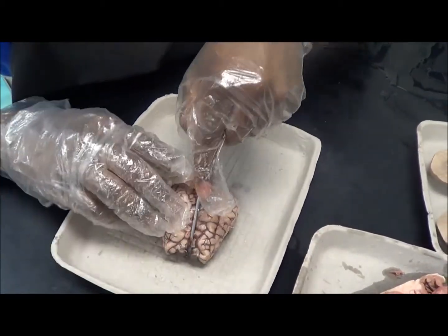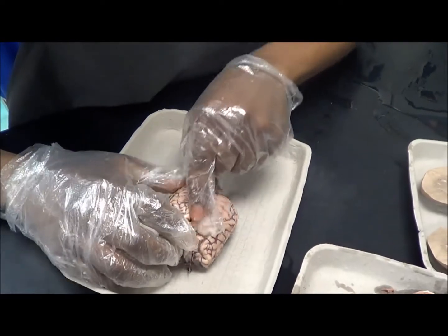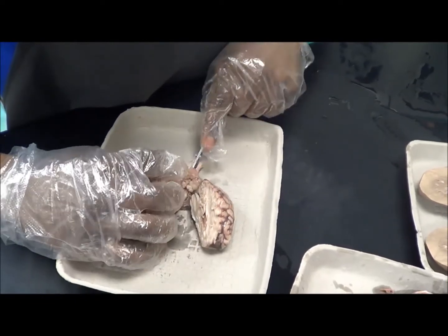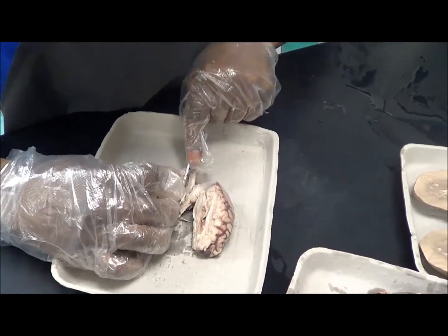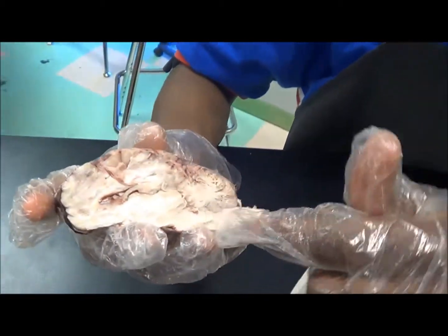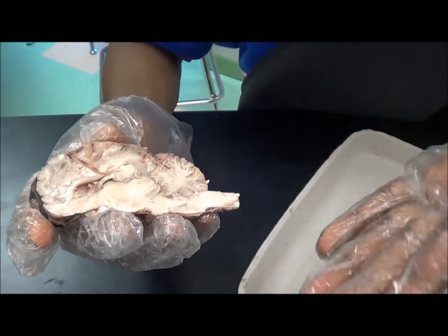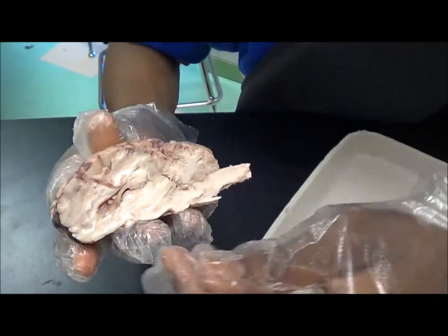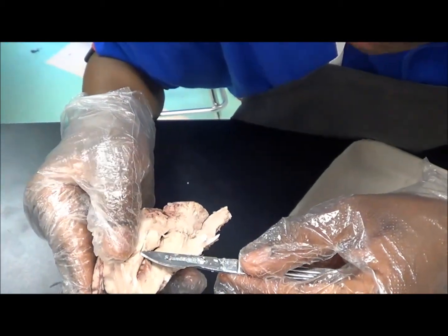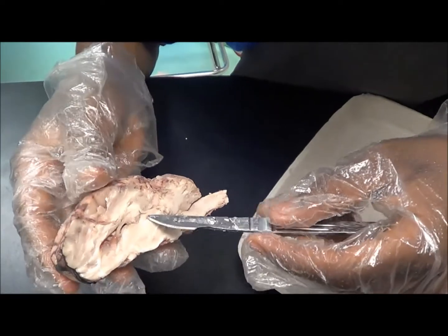Then as you cut through directly in half and look at the side of the brain, this white tree that you kind of see here is called the arbor vitae, or the meaning tree of life. Then as you look inside the brain, you'll start to see the fourth ventricle and the third ventricle. The ventricles are pretty much like storing chambers.